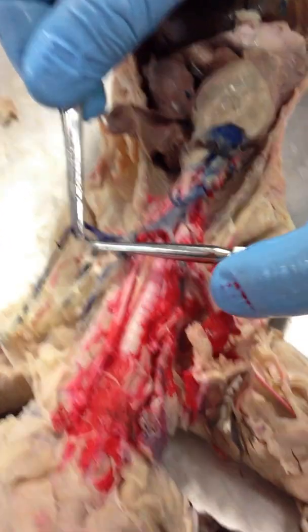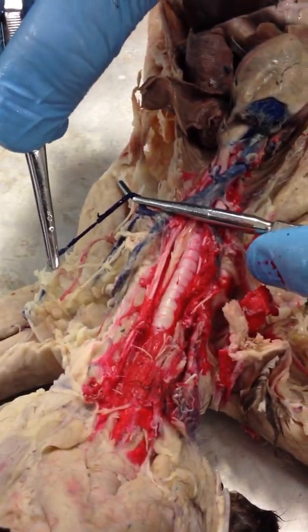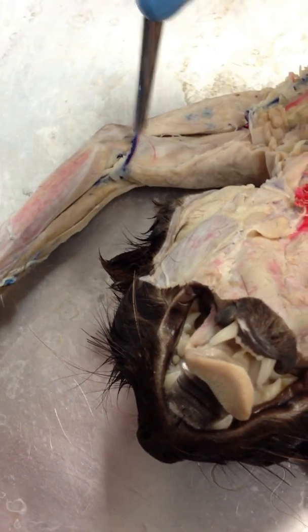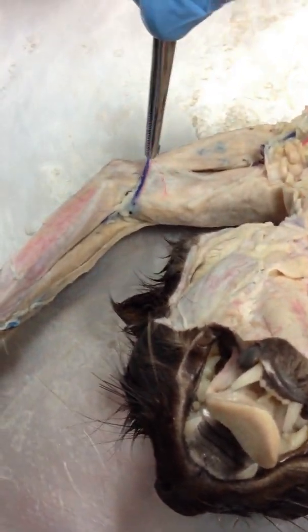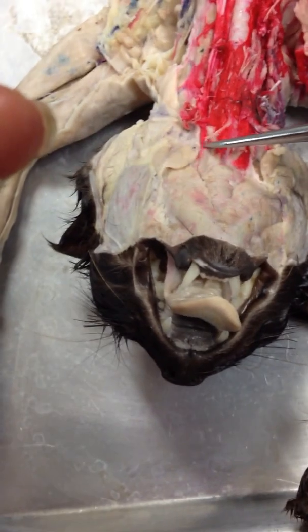The left axillary vein is going to continue out across the arm, where we call it the left brachial vein. And then up here we call it the median cubital vein — this would be the left side. We also have our transverse jugular, which on this cat appears to be missing, but it goes right across here.